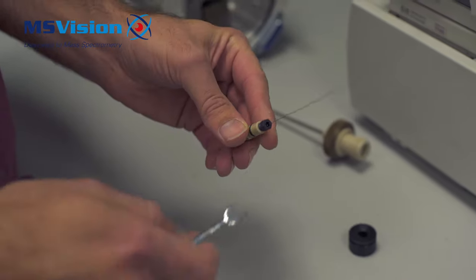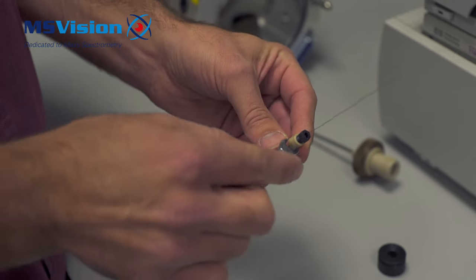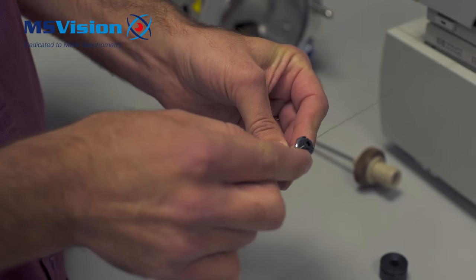Take a quarter inch spanner and loosen the black backing nut, unscrew it fully, and remove the old electrode.